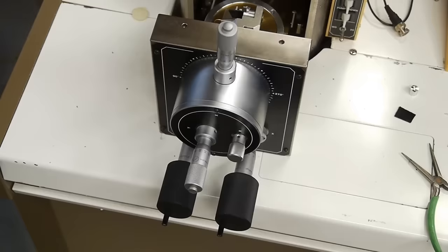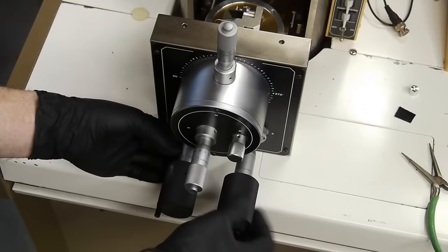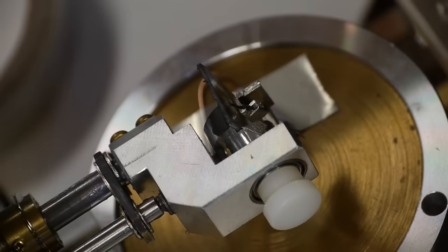This particular electron microscope has two separate stages inside with their own motion controls. This allowed me to put the needle with its makeshift tone arm onto one stage and then put the piece of LP that's been coated with silver onto another stage. Then I could move both of them independently so that I could arrange it to make an aesthetically pleasing image.